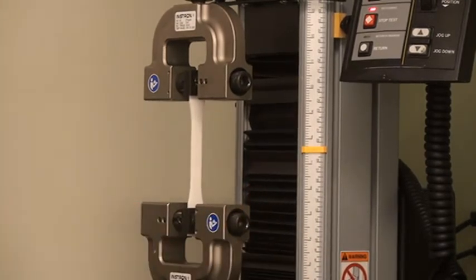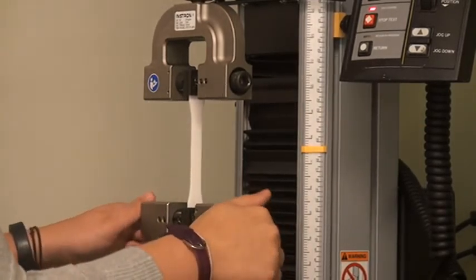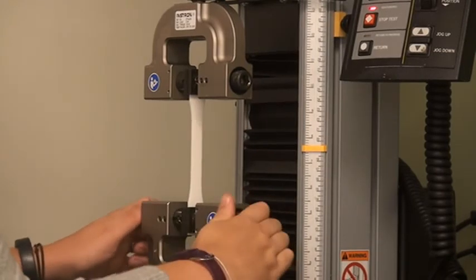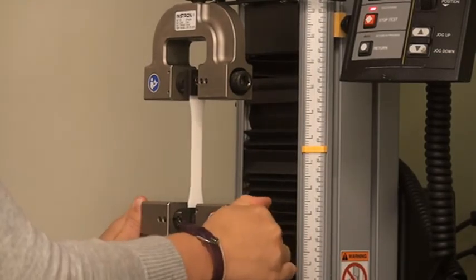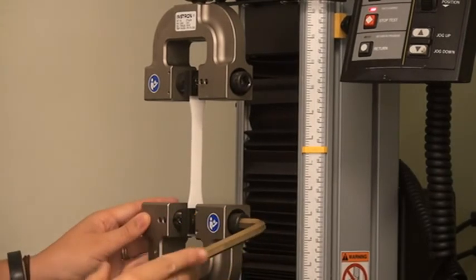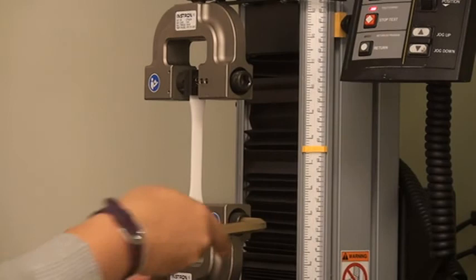Again using the markings on the sides of the carriage as a guide, use the screw knobs to make sure your sample is centered in the lower grip. Use the hex wrench to tighten one side of the screw knobs to prevent your sample from slipping.